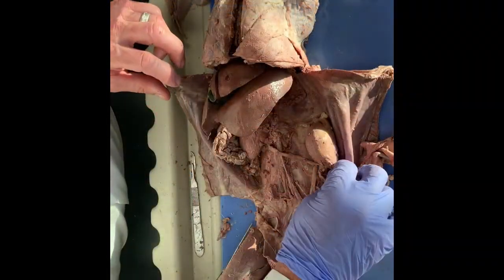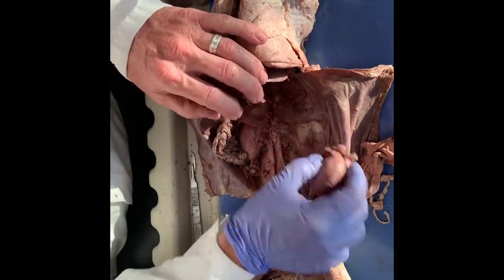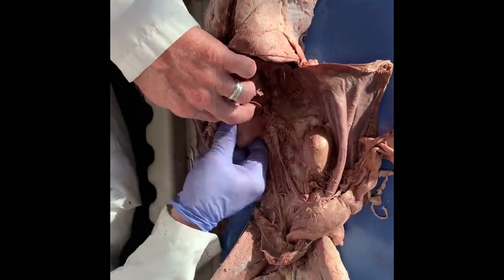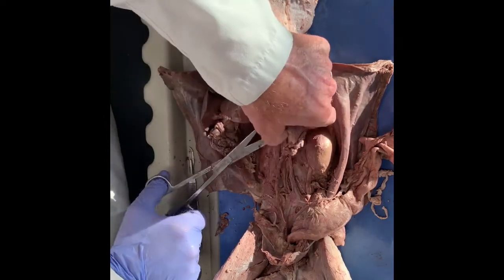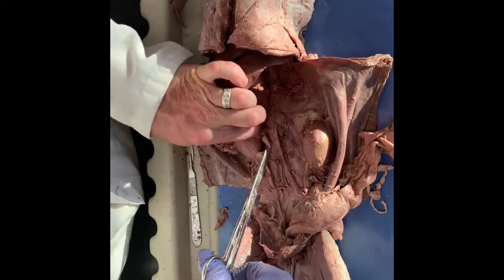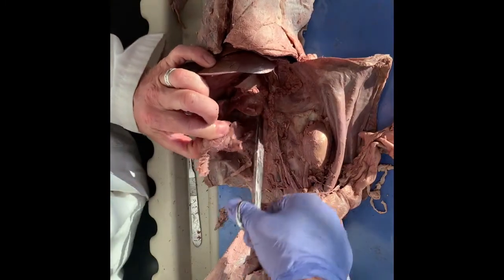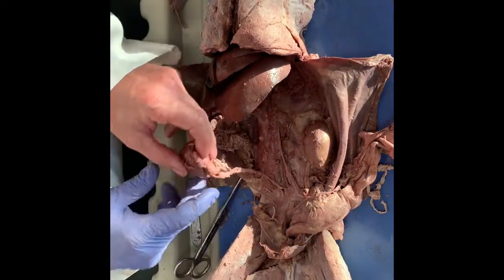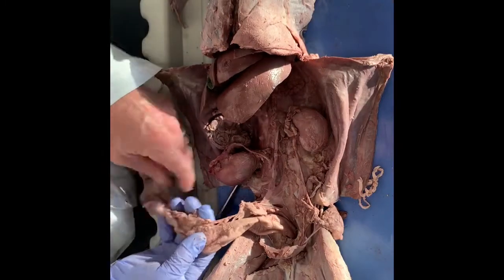Okay, so now I'm going to take out the ureters and the bladder. And so this ureter is free, okay? Or this kidney, sorry. And then I'm going to remove this kidney. So I'm going to come over here, break the connective tissue that connects it to the dorsal wall. I'm going to come above the ureter, accidentally severed the ureter. Okay, so that's the right kidney. This is the left kidney. And then it all connects to the bladder.